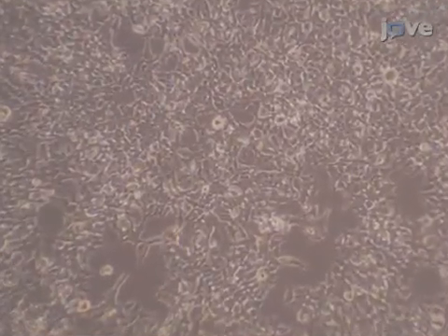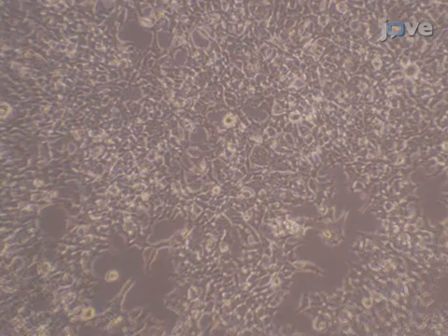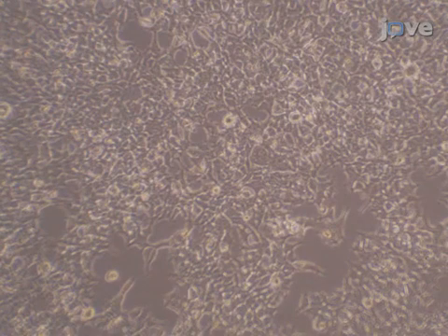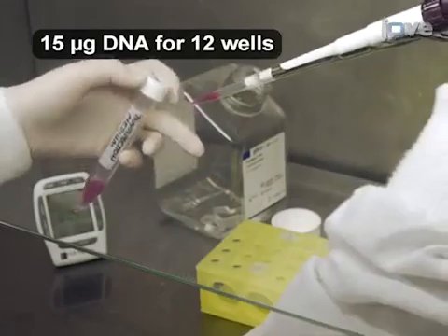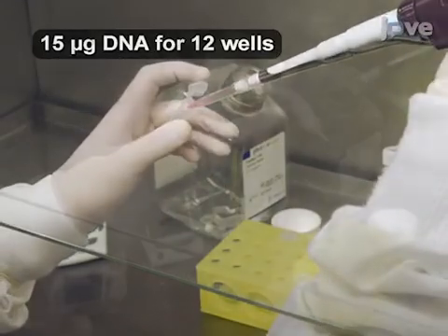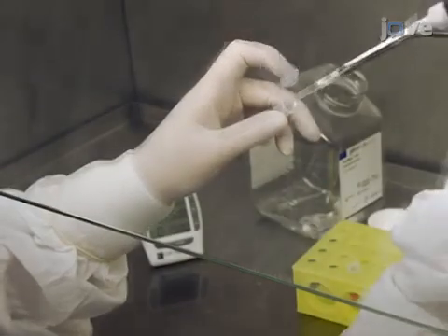On the day of transfection, check that the cells have reached 80-90% confluency. Dilute 1.25 micrograms of vector DNA per well in 300 microliters of transfection medium.